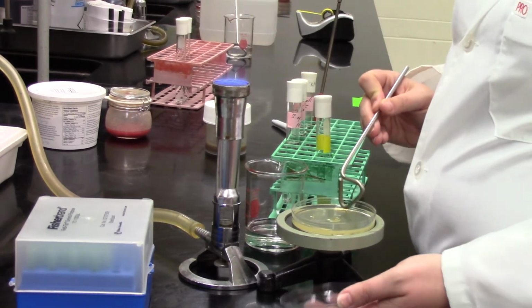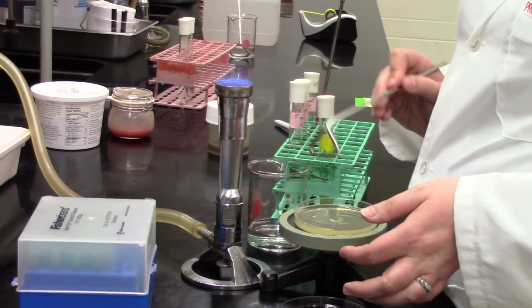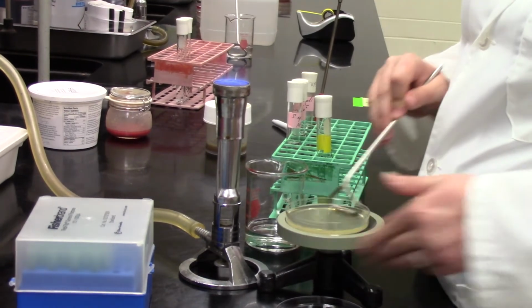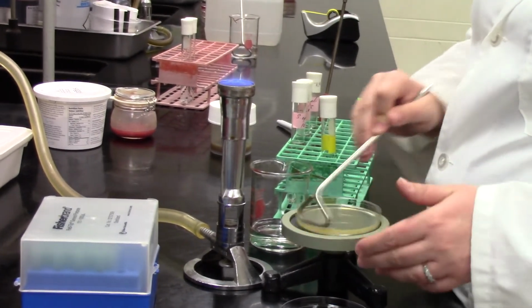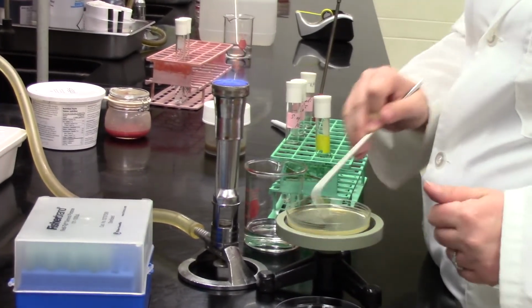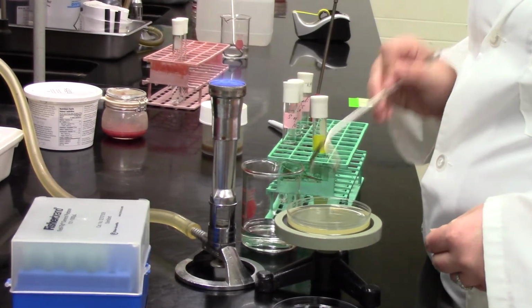One thing I'll mention now, just as Sabrina does the very last plate, is the dilutions. Here we made a very simple dilution. We did a 10-fold dilution, also called the 10 to the minus 1 dilution or 1/10 dilution, where we put 1 ml of our plant juice into 9 ml of saline to give us a total of 10 ml.